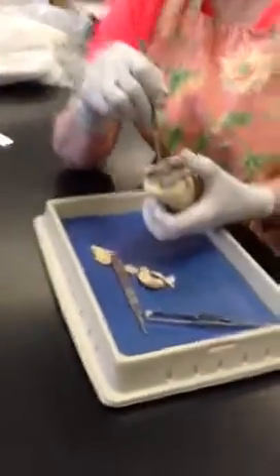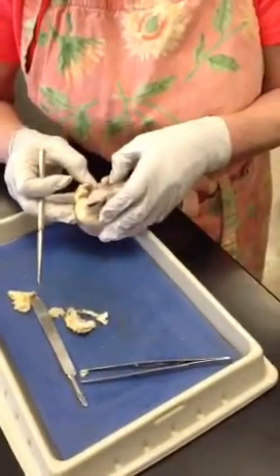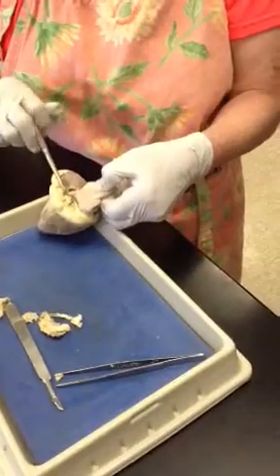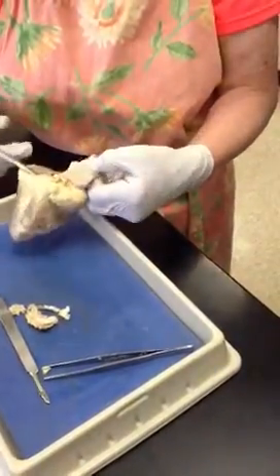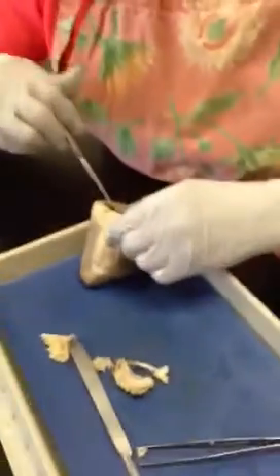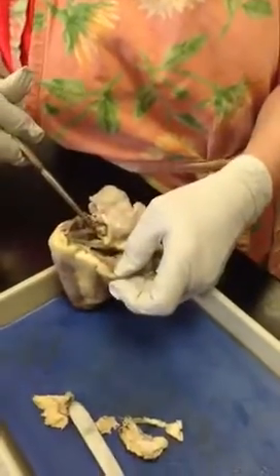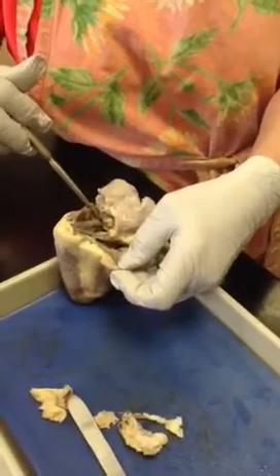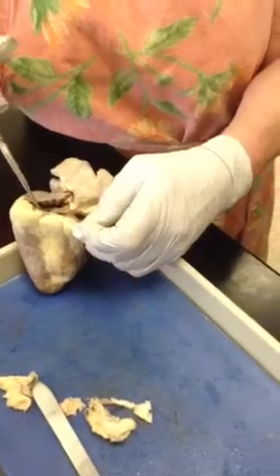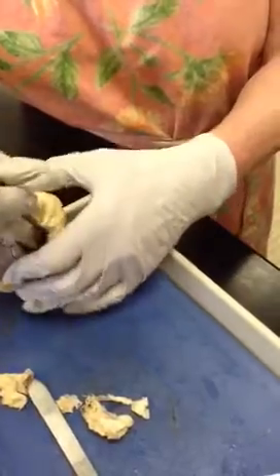Vena cava. The opening for the inferior vena cava on this guy really didn't get done too well. They cut him too close, so your inferior opening would be there. Then right here, that opening is the opening to the left atrium, so it's the pulmonary vein. This would be inferior, this would be superior. Here is your brachiocephalic.